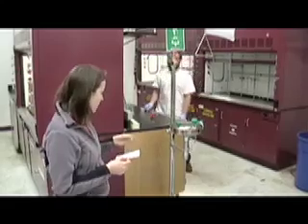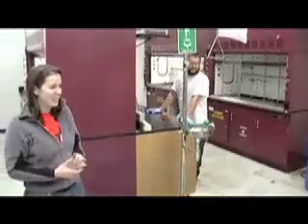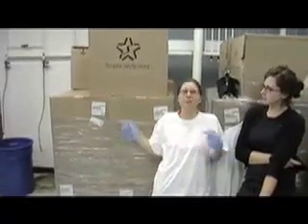Use the eye wash. Also a good job, yeah. But eye wash is better at doing the eyes than the shower. So don't just stand under the shower and think about it. You better use the eye wash.